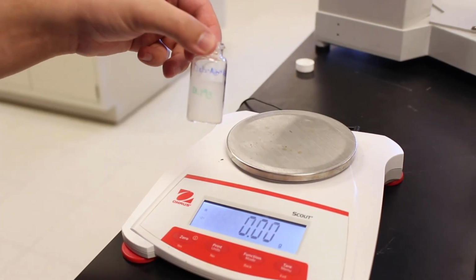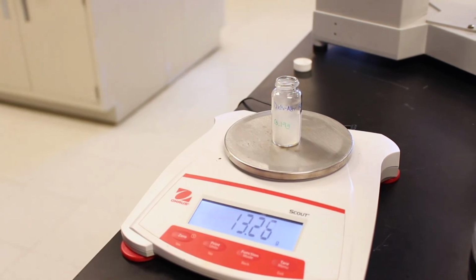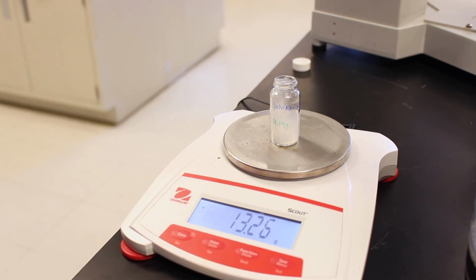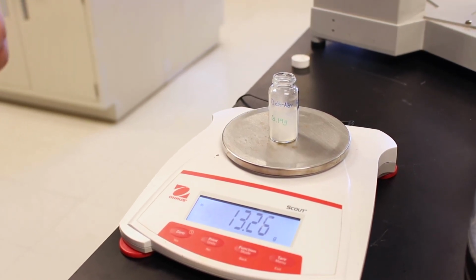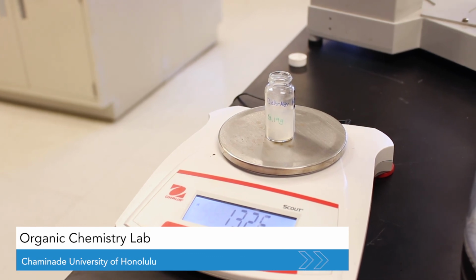Okay, so we have our Diels-Alder product here. It's been drying in the vacuum desiccator. Now we're going to get a mass. Okay, 13.26 grams minus the tare gives us 0.07 grams. So you can use that value to calculate your experimental yield for this reaction, the percent yield.